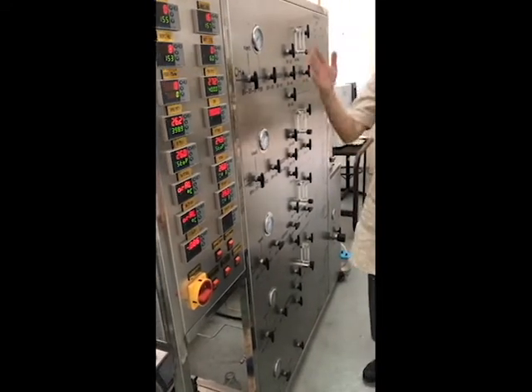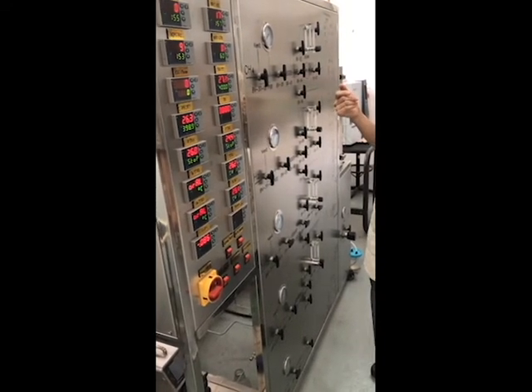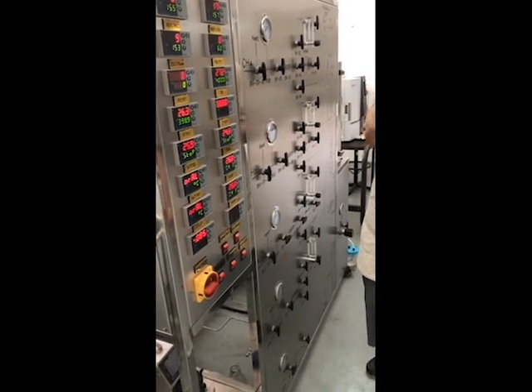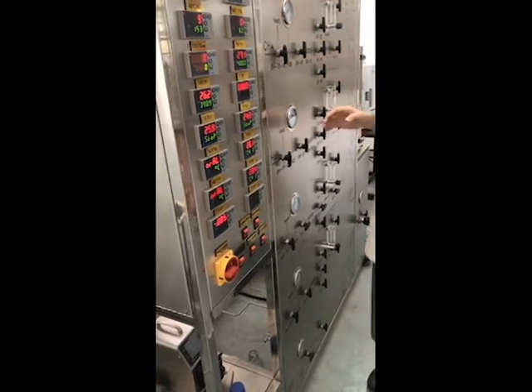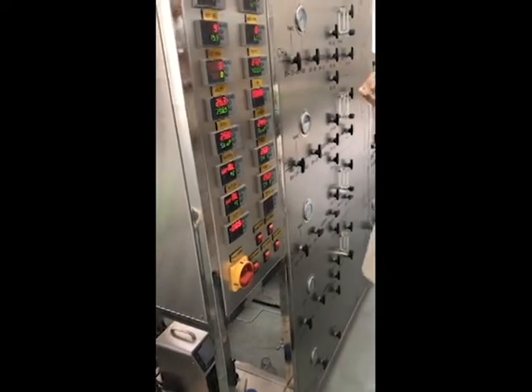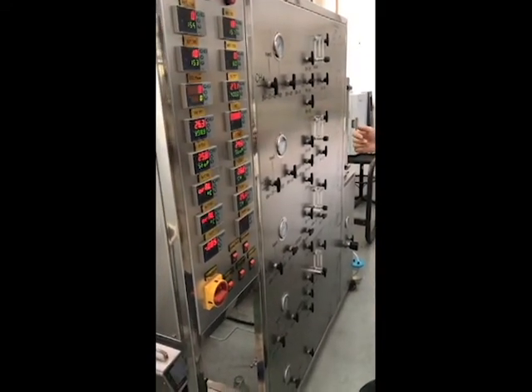So there are quite several reactions that can be investigated here. It depends on how you apply it. You can explore the application of the system, and you can advertise to other researchers to come to rent your system to support your finances. So today I will guide you based on your dry reforming.